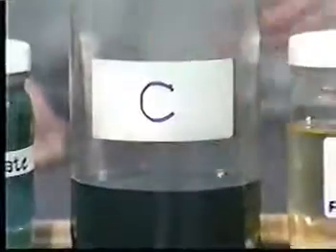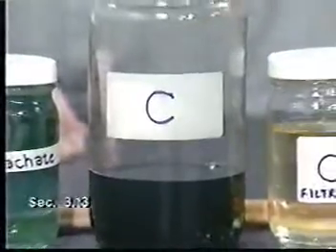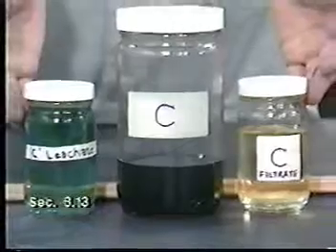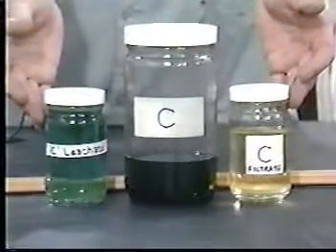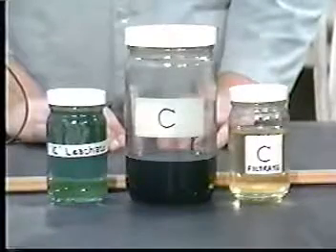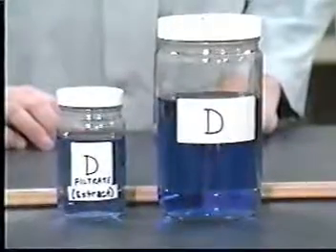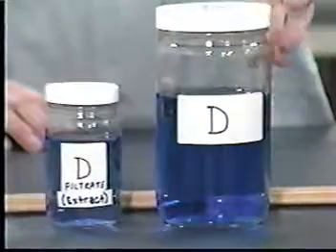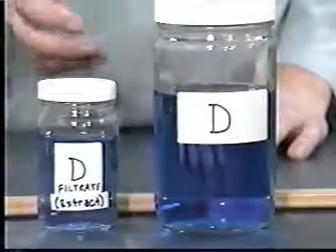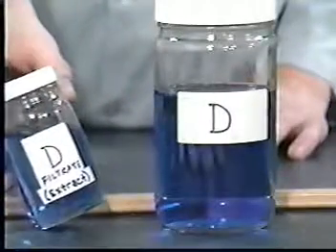Waste C is an example of when the initial liquid phase is not miscible with the aqueous extract. For this waste, each of the two liquids is analyzed separately, and then the results are combined in a simple volume-weighted average. Finally, waste D did not have any significant solids, so after initial filtration, it was placed aside while extraction was performed on the other wastes.